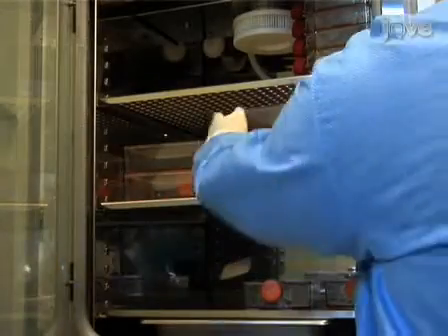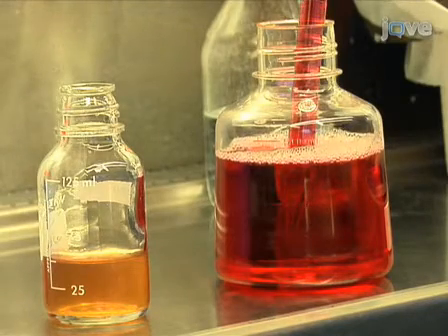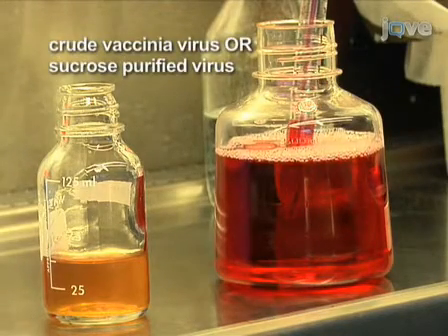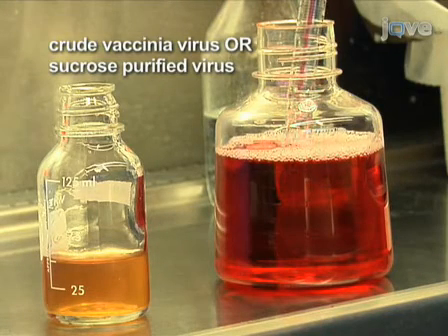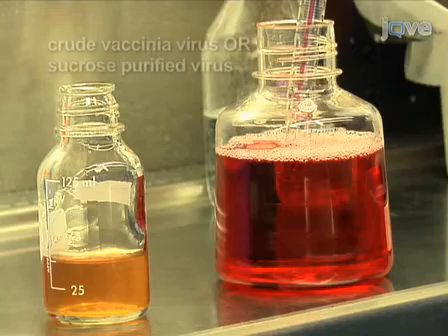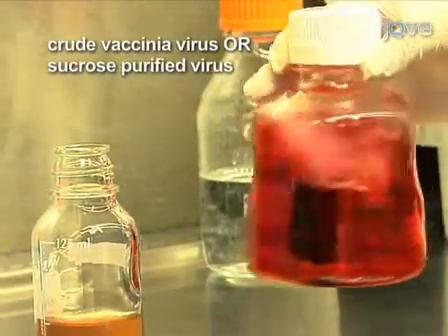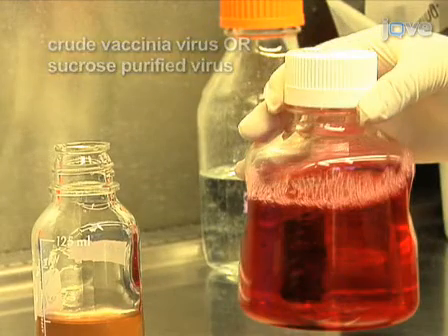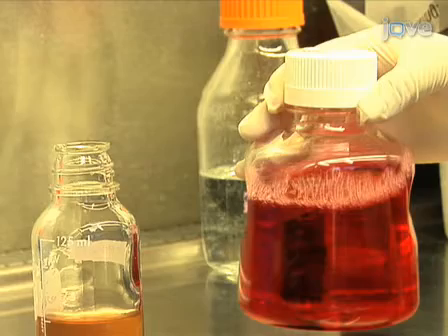To set up for the infection, grow HeLa cells in flasks and wait until the cells are approximately 80% confluent. Next, be sure to prepare enough viral growth medium for the experiment using regular DMEM with 2% FBS and no added antibiotics. The infection can be performed with either a crude stock of Vaccinia virus with a known titer or sucrose purified virus with a known titer if you're concerned about host gene expression. If you are using sucrose purified virus, skip to the next section.